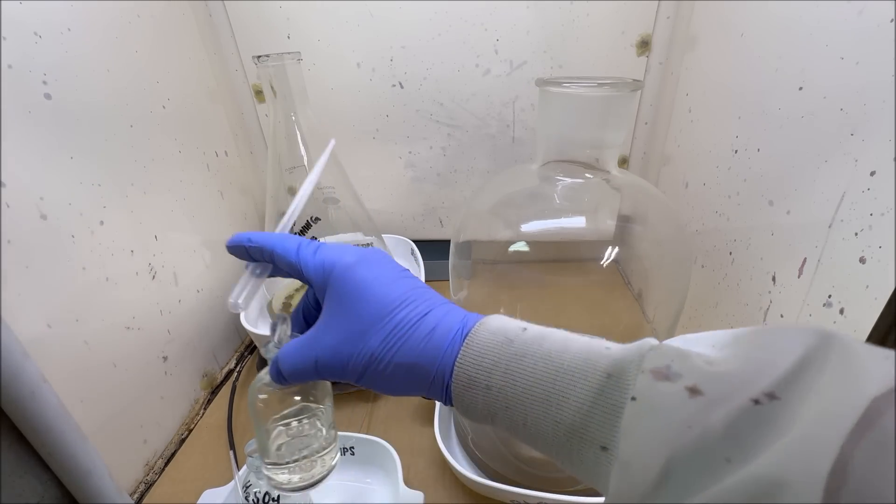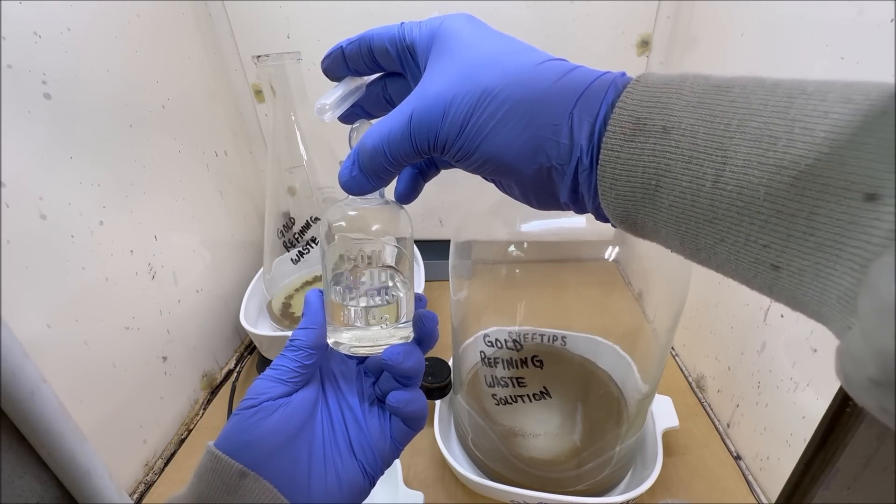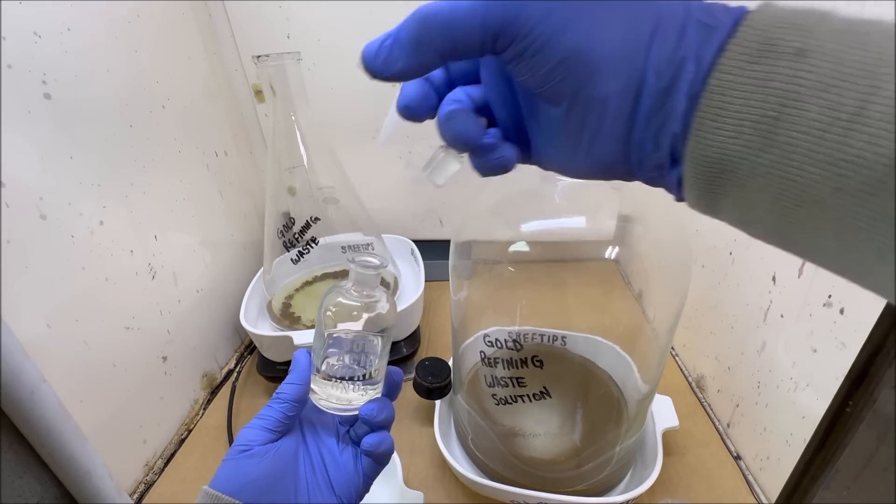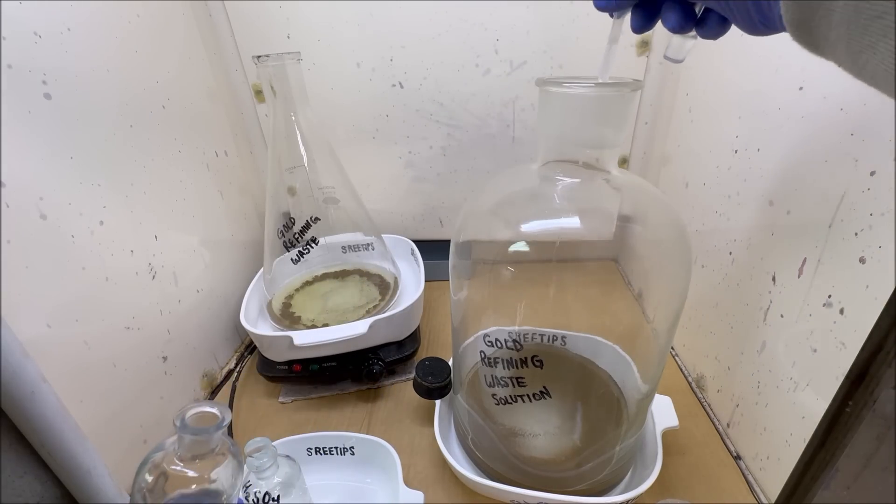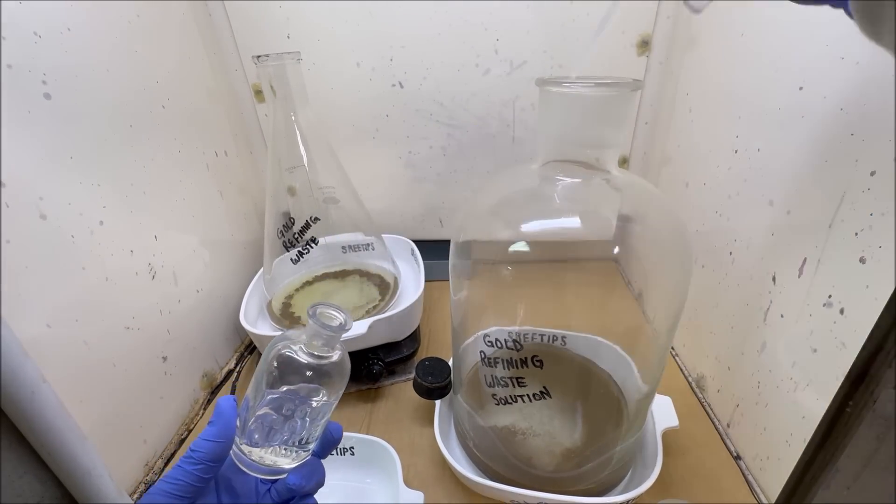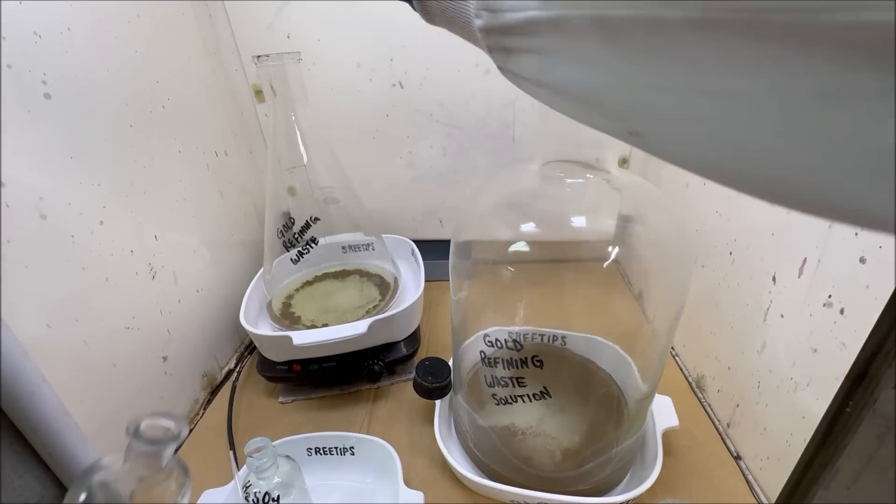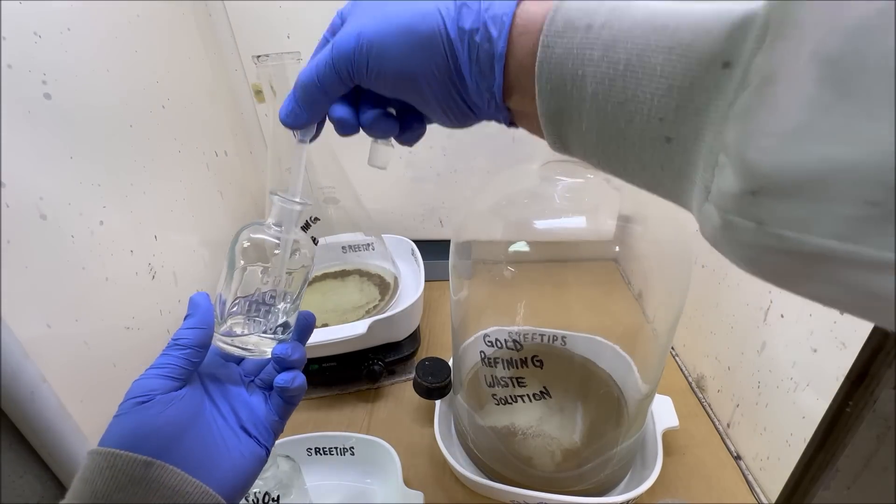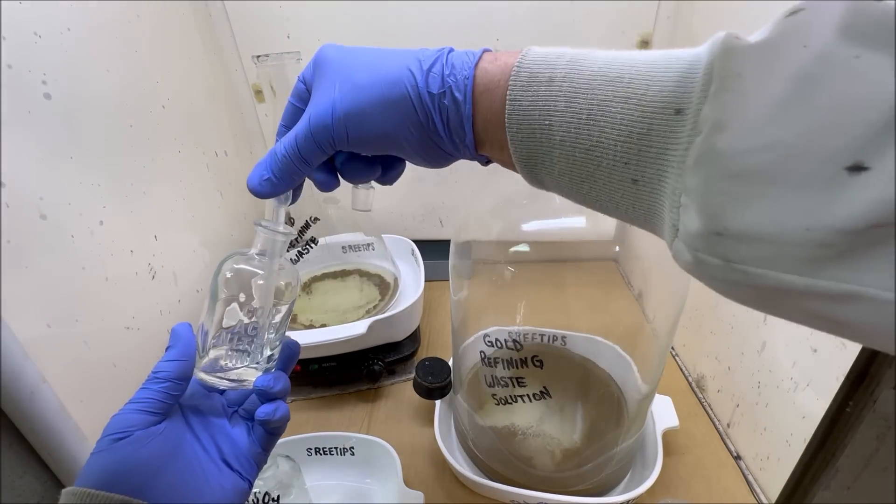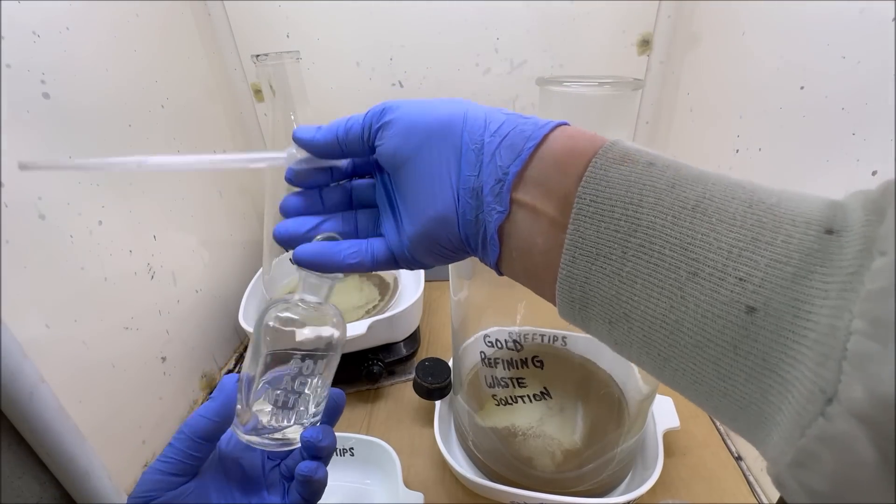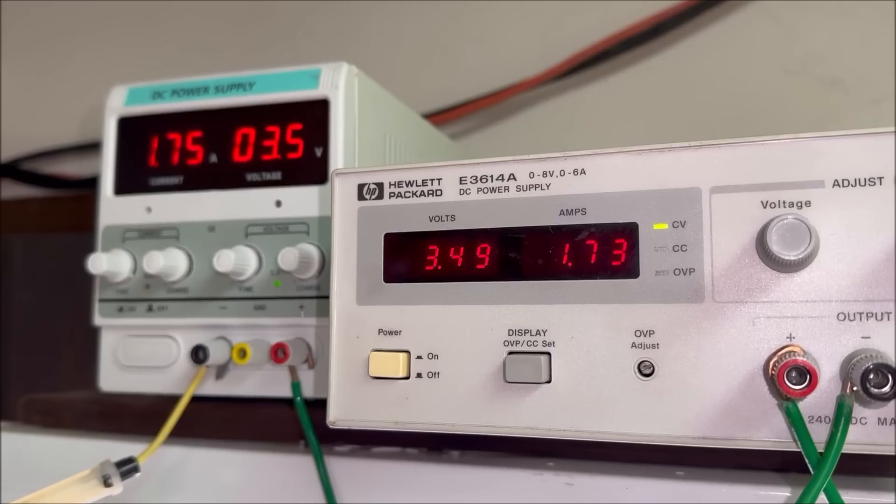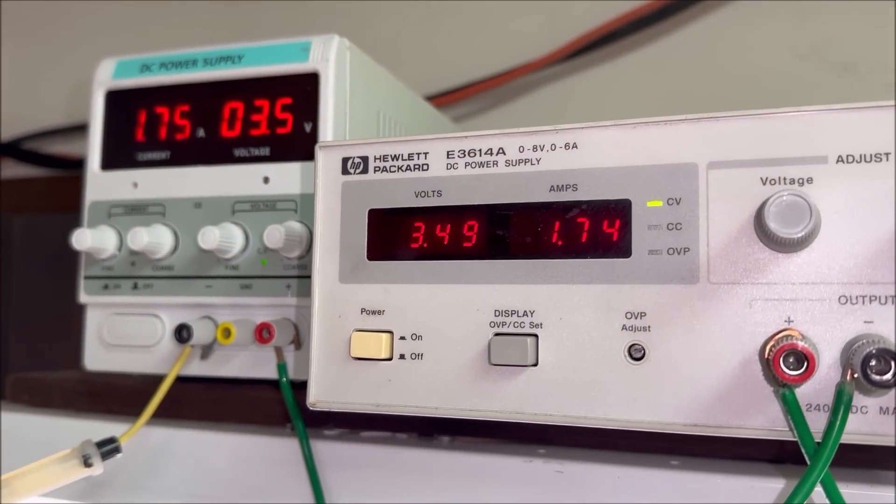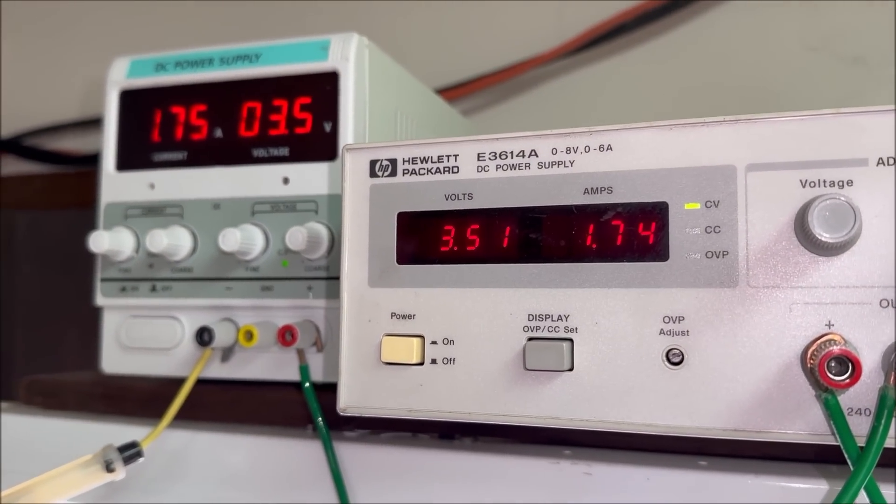I've got some nitric acid. I'm going to put a few squirts of nitric acid in here. Now what we'll do is just let these react and try to get this gold to go into solution.